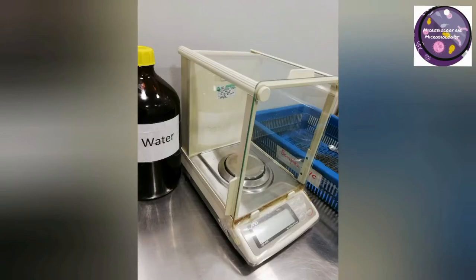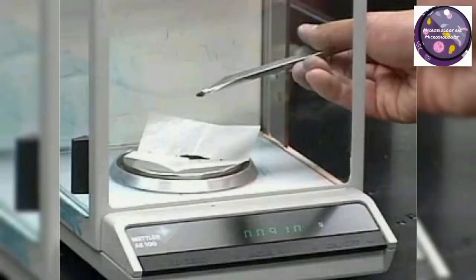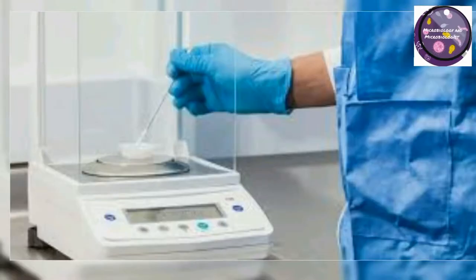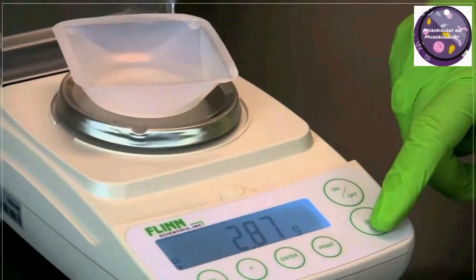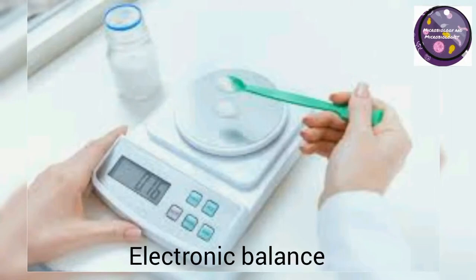This equipment is used for measuring dehydrated media, buffer solutions, solutes, and solvents. It helps to weigh solutes, dehydrated media, and chemicals for the preparation of buffer solutions, normal saline, and media preparation. I would personally suggest this kind of electronic balance for the microbiology lab, as these are easy to handle and weigh.